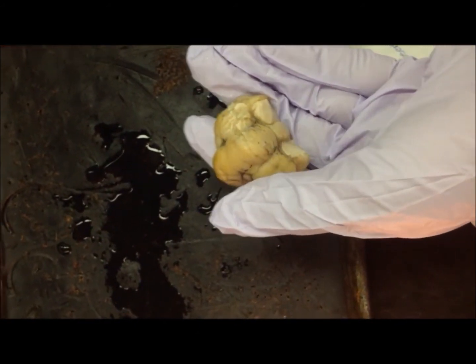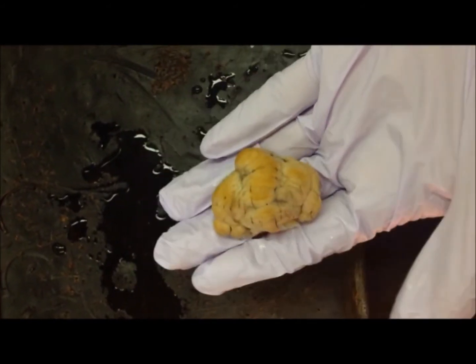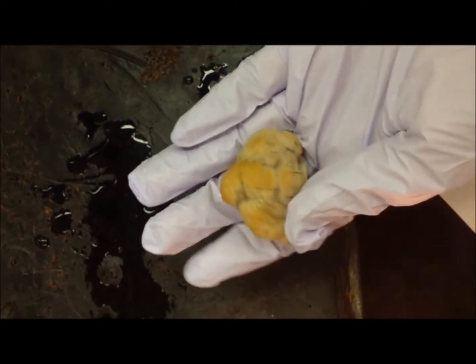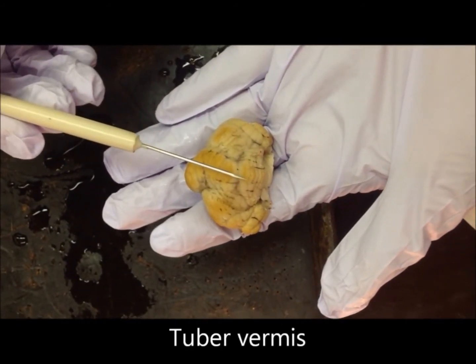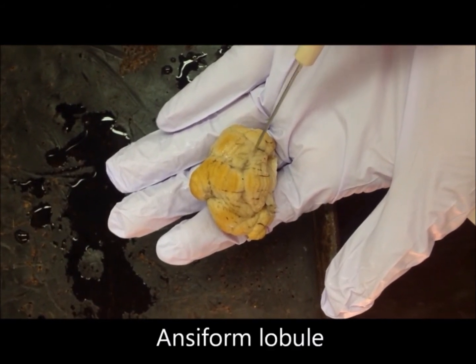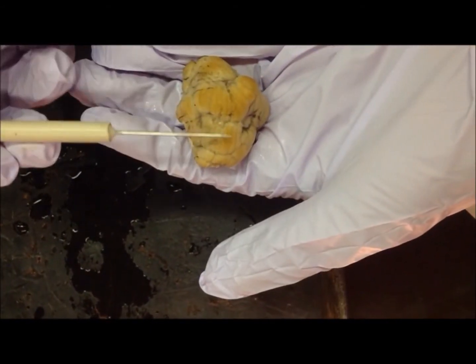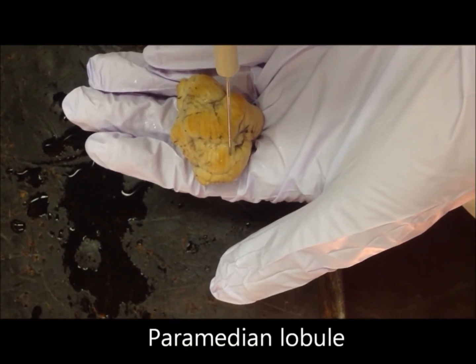The nodulus is the most ventral structure. You cannot see it when the cerebellum is attached to the brain. That is because the nodulus folds inwards. The medial structure is the tuber vermis. Lateral to that, and more rostral, would be the ansiform lobule. Lateral to the tuber vermis, and more caudal, would be the paramedian lobule.